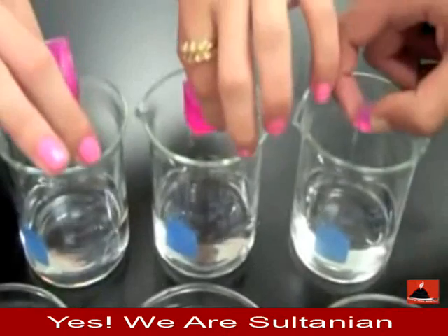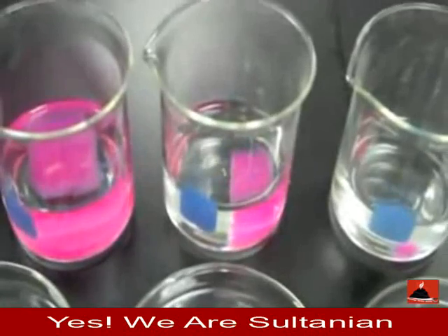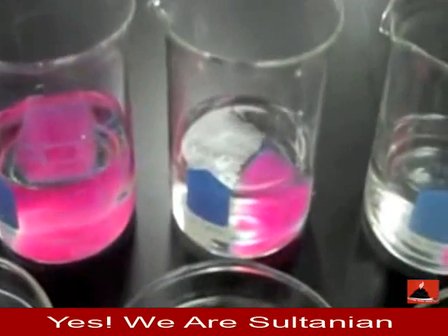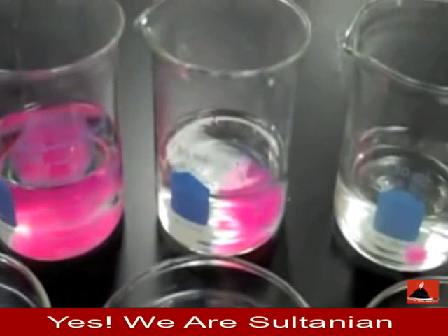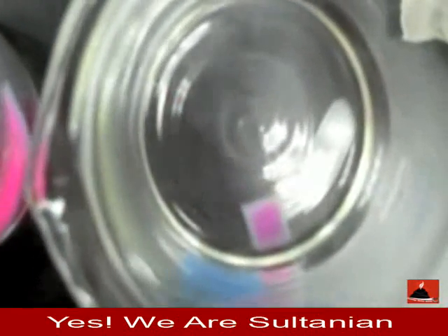When the cubes are placed in the hydrochloric acid, the acid representing the raw materials will diffuse into the cubes, turning the indicator clear. Let's see how this rate of diffusion varies. Raw materials must be able to reach all parts of a cell's volume quickly.